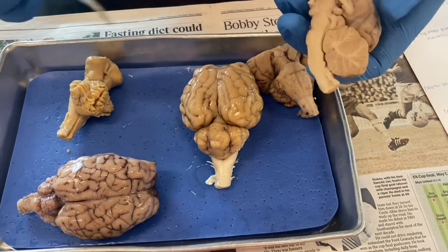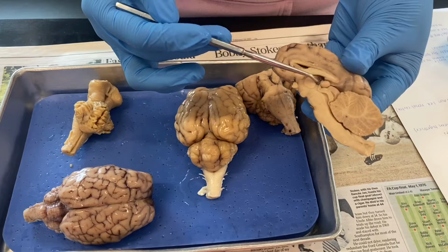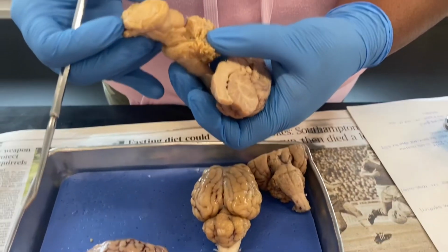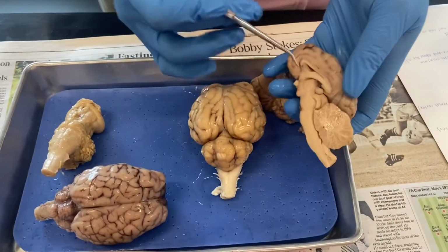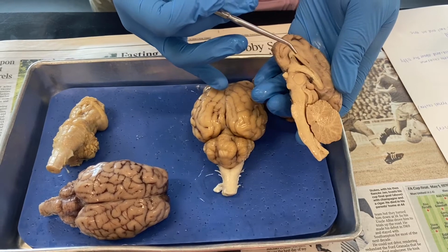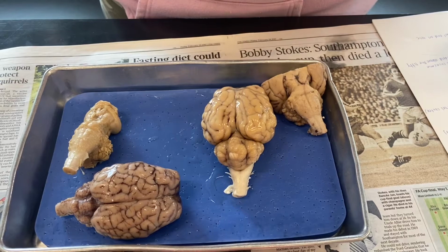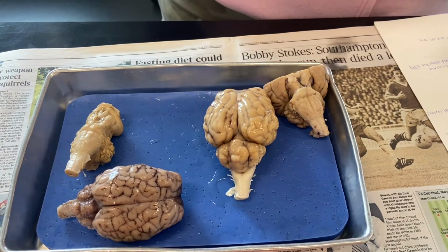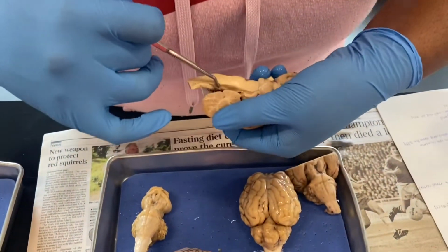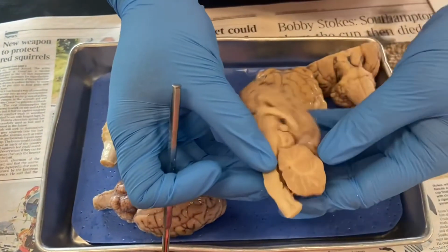And then our choroid plexus is going to be right here, and I don't think that there's any in here. Yeah, no, there's no choroid plexus in here, but it'd just be right here within the third ventricle. And yeah, that's it. Did you say the cerebral aqueduct? No, I'm trying to find the choroid plexus because it's supposed to be in here. Unless they're going to split it out and do this. Yeah, they probably were. So, I see it.